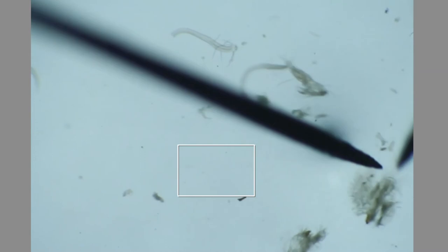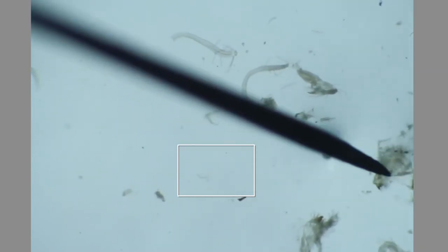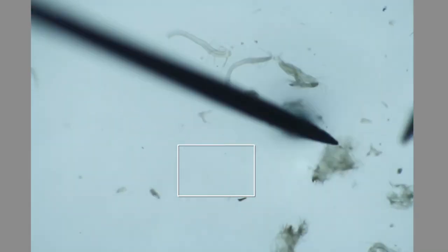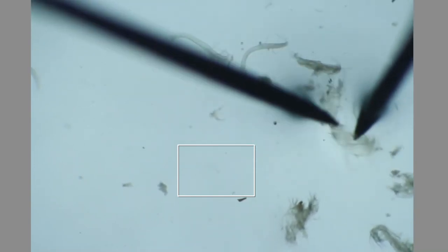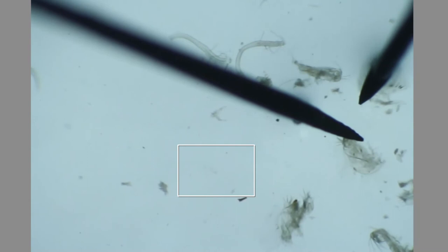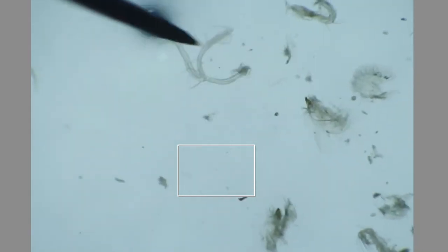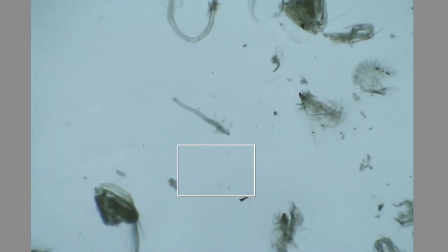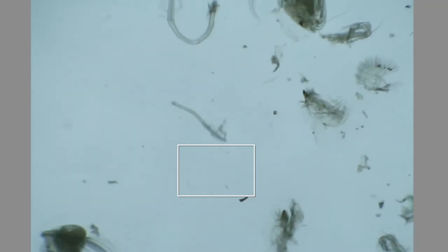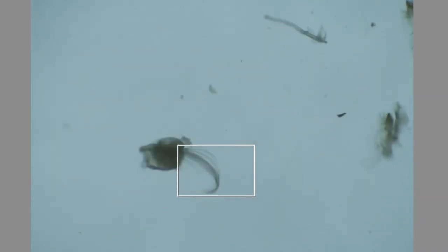This looks pretty satisfactory. I'm going to pull this apart a little bit, so when we flatten it out it will look a little nicer and I can see everything better. Before I put on the cover slip, I'm going to make sure everything is nice and spread out but towards the center. If I put it too close to the edge, it will fall right off the slide.